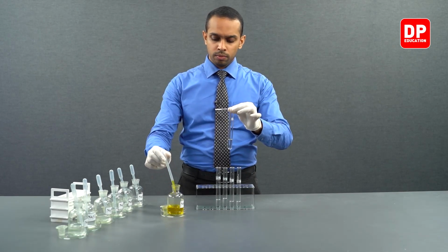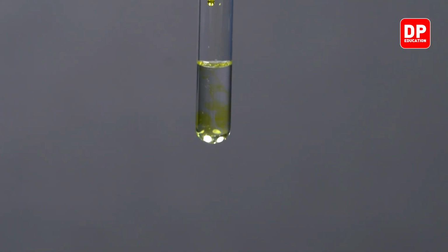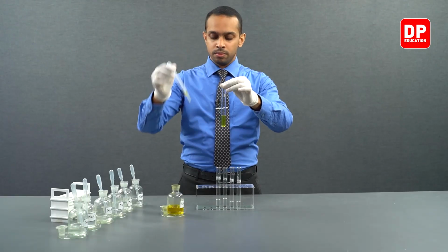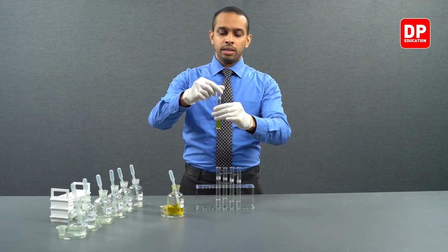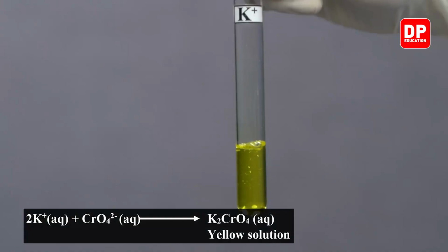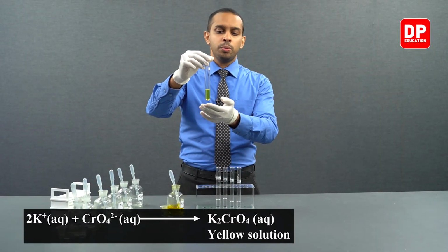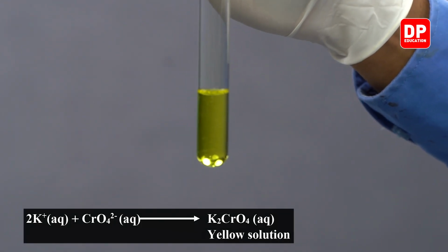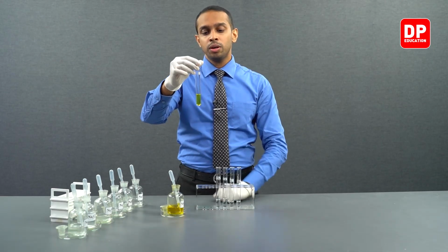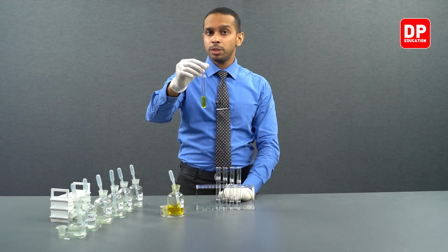Now, we will be adding a small amount of sodium chromate to introduce the chromate anion into this solution. And after introducing it, let's mix it really well. And upon addition of the sodium chromate solution to potassium 1 plus aqueous ion solution, we observed the color of the potassium 1 plus aqueous ion solution changed to a yellow color. But we did not observe the formation of a precipitate.